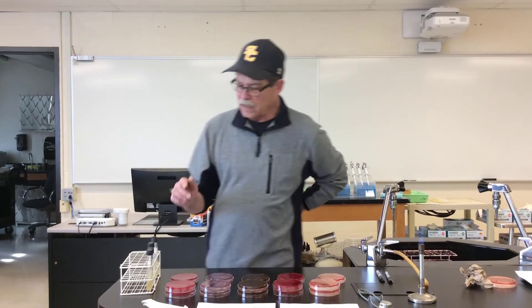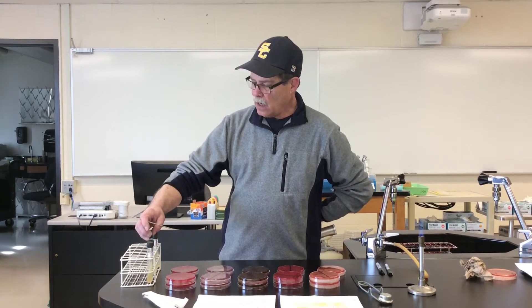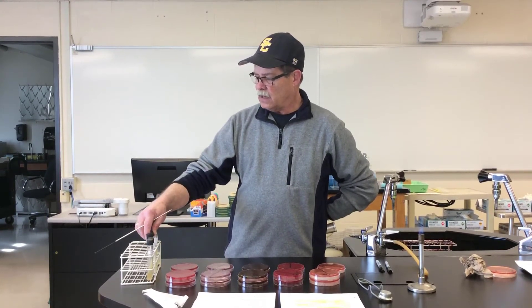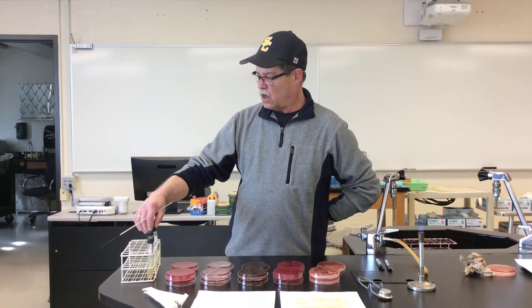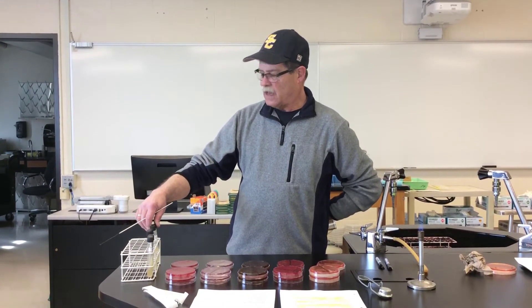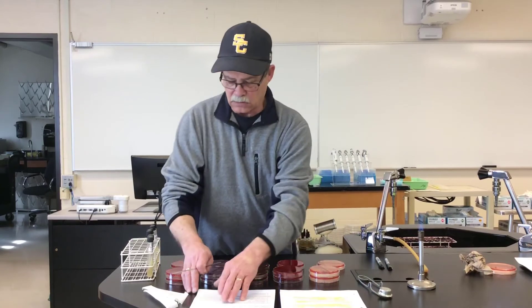The organisms we'll be working with are Staphylococcus aureus, E. coli, Streptococcus pyogenes, Enterococcus faecalis, Proteus vulgaris, and Pseudomonas fluorescens.